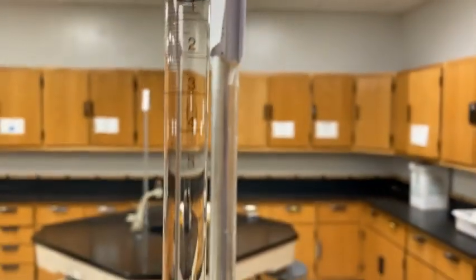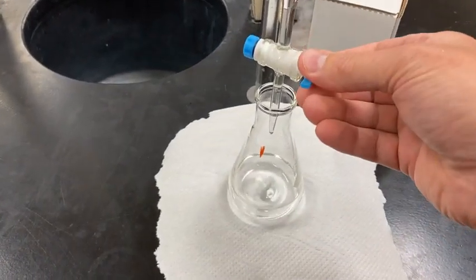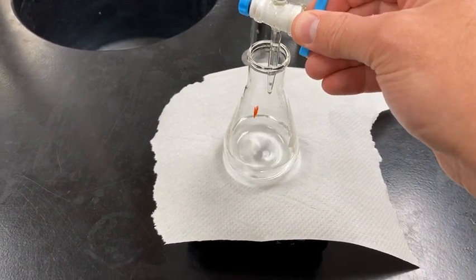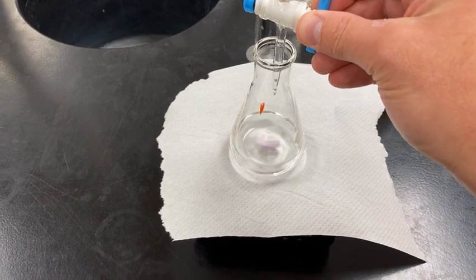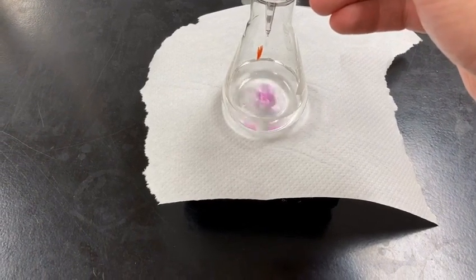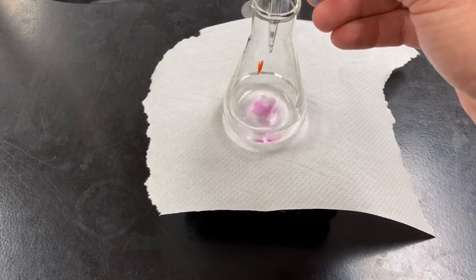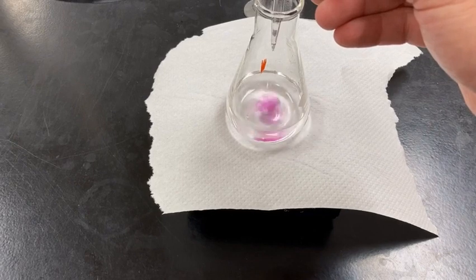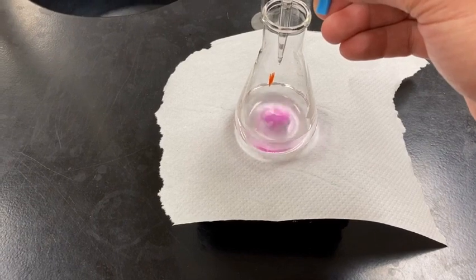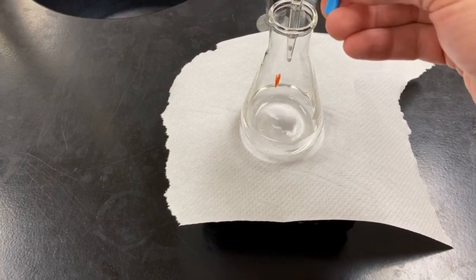All right, and then at this point what we're going to do is titrate. So I'll open up the valve. I did a little jiggity jag for the burette so there's no air pocket in the tip of the burette, and I'm just going to add drip by drip here. And again, we're looking for it to be nice and light pink throughout that solution, and let it persist for 30 seconds or so, and I'll know I'm at the equivalence point. It's turning pink already. Let me pause it and see if it goes away. It's disappearing, so I'm going to add more.